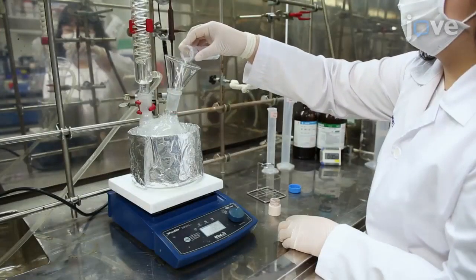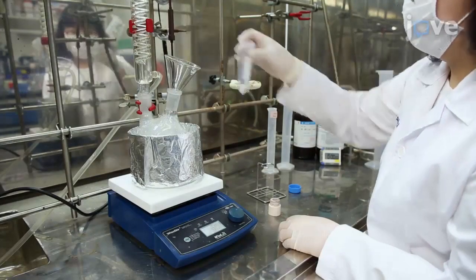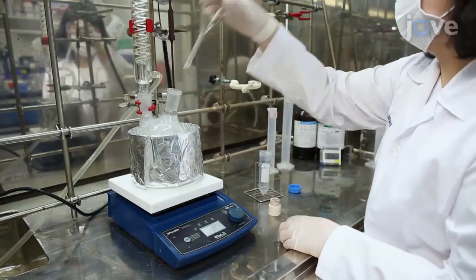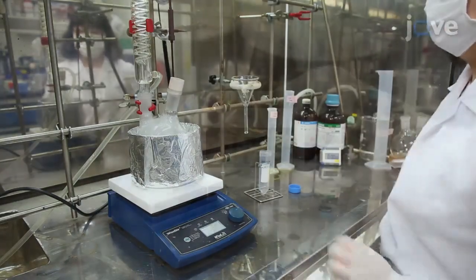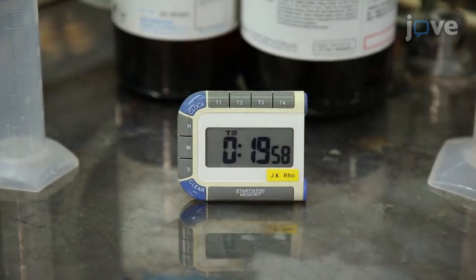Reflux the resulting mixture for another 20 minutes for the complete reduction of the gold salt.